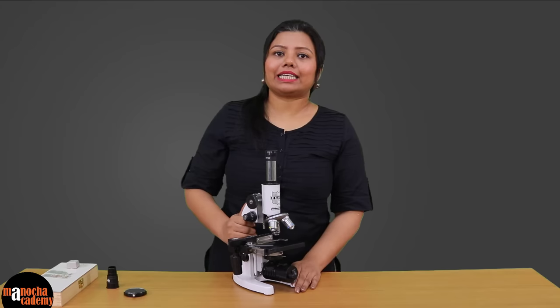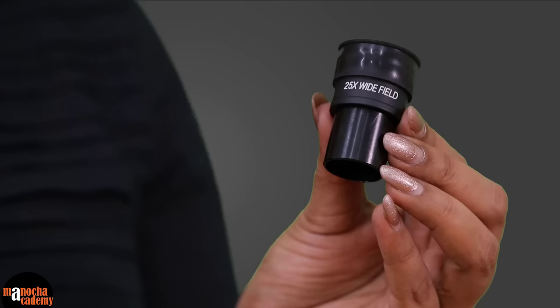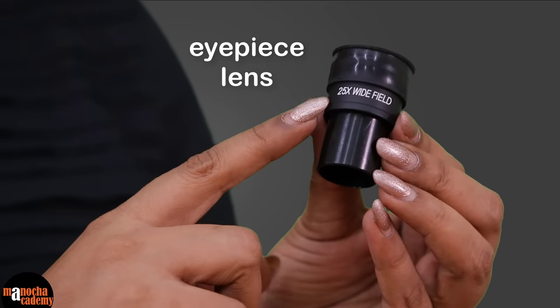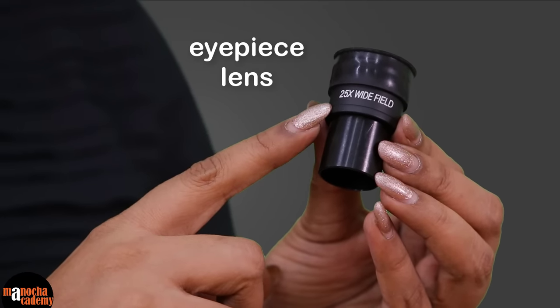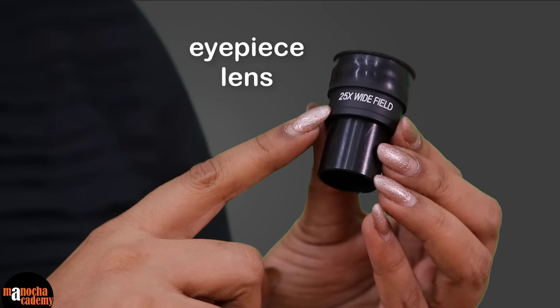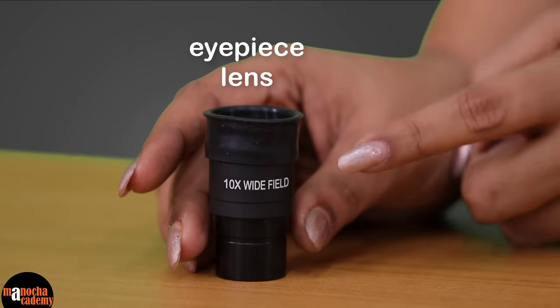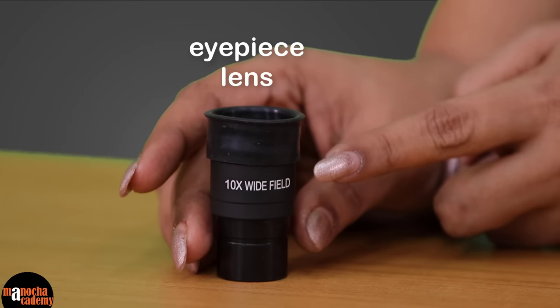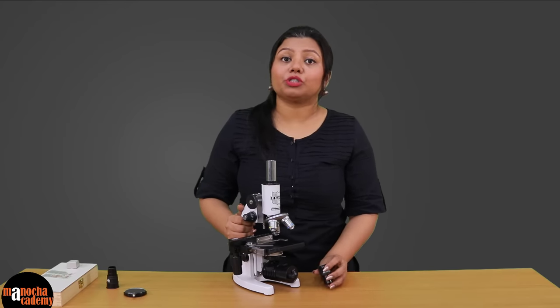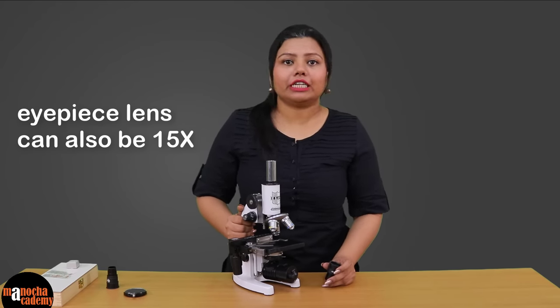The first lens attached to the body is known as the eyepiece lens. If you see closely, the eyepiece lens has a certain magnification, which here is written as 25x. You may have an eyepiece lens which is 10x, magnifying the image 10 times, or one which is 15x, magnifying an image 15 times.